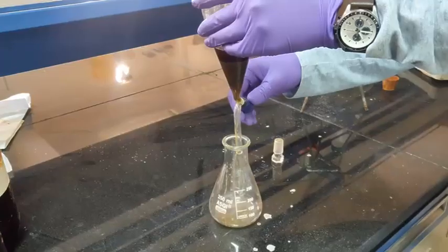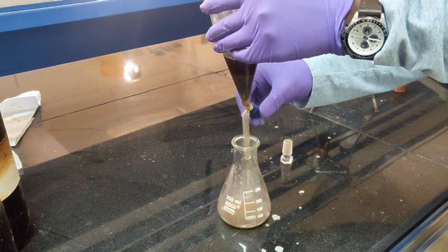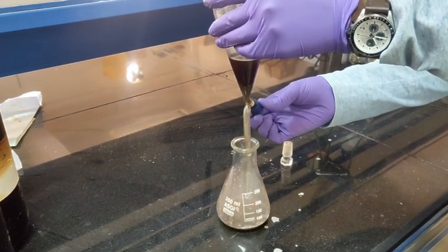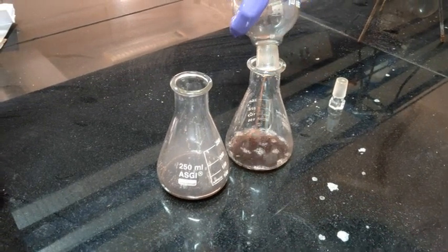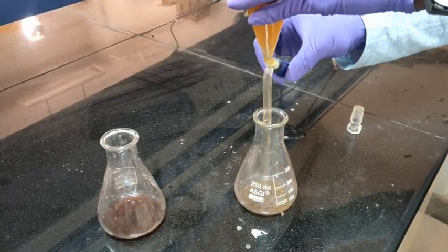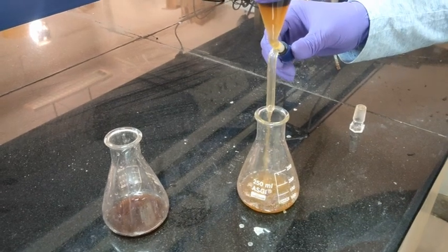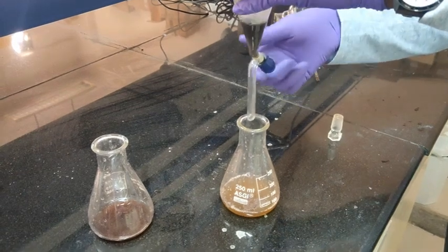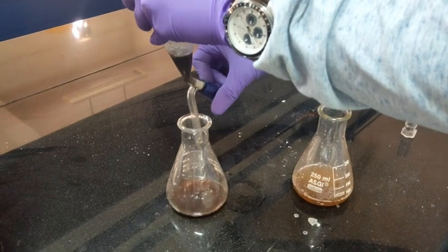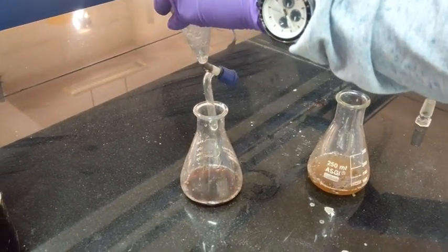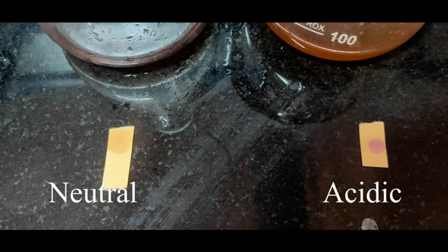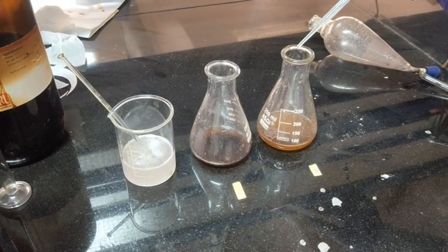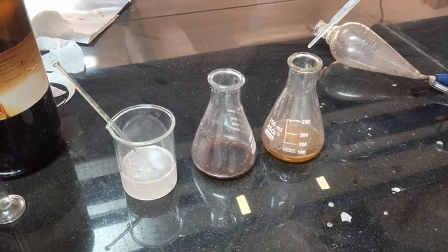Separate both phases and collect the acidified phase, the bottom layer, in two separate flasks. This process was repeated twice. To the acid portion, add 8 molar potassium hydroxide in a dropwise manner till the solution becomes basic.